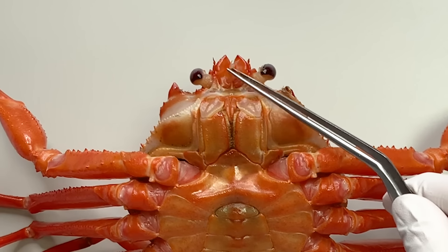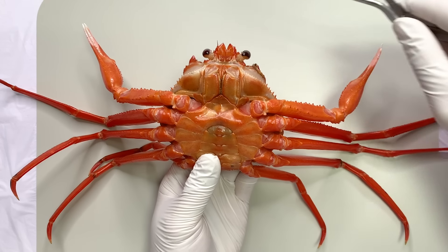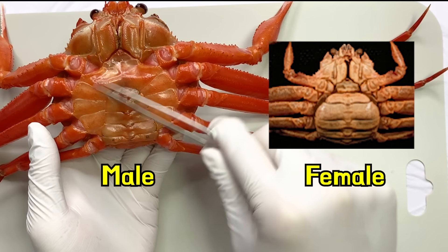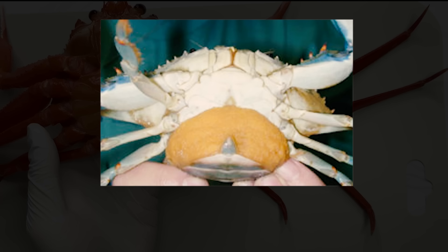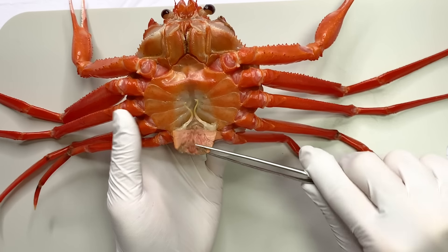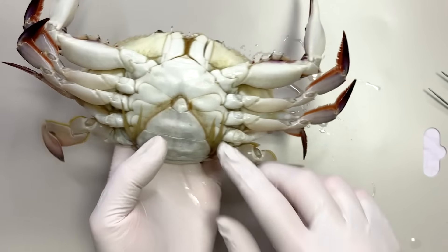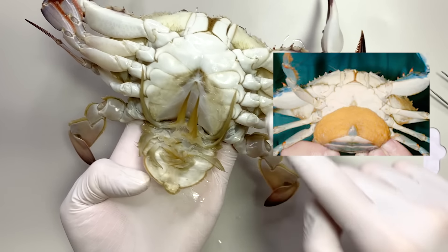On the upper part, there are also two pairs of antennae. Crustaceans use antennae for various sensory functions. When we observe the shape of the abdomen, we can distinguish between male and female. Male crabs have a narrower abdomen compared to females, because females carry eggs inside their abdominal flap. Crabs engage in a close embrace during mating. The male's abdomen has two pairs of appendages used to transfer sperm to the female's abdomen. Inside the female's abdomen, there are more appendages, which are used to carry and hatch their eggs.